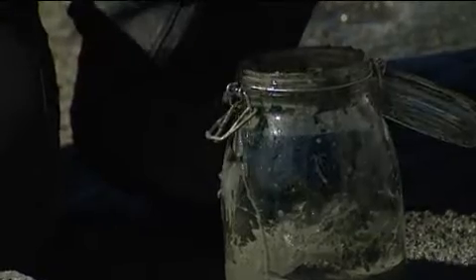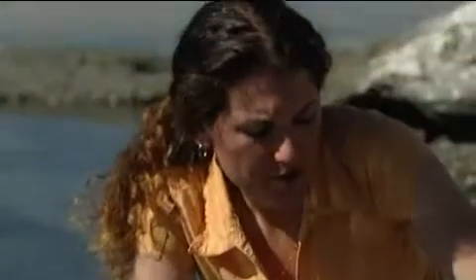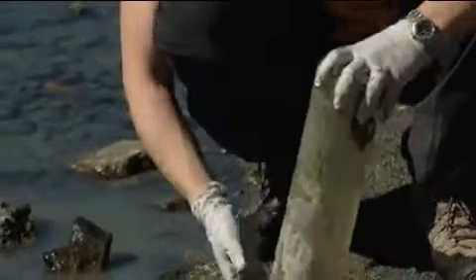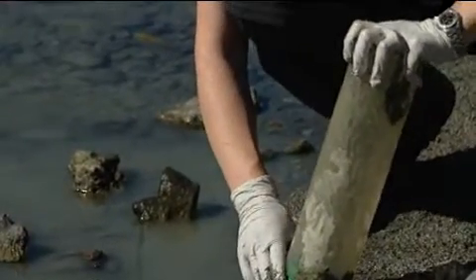Then all I'm going to do now is just get a little bit more of the water. So if I want to take an environmental sample, bring it back to the laboratory, but try to keep it as related or relevant as possible, I'm going to add water from the overlying area and fill it up. So you're taking sort of its habitat — taking a little bit of its habitat to go.